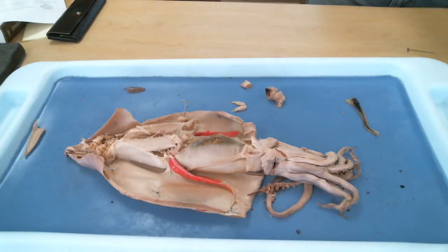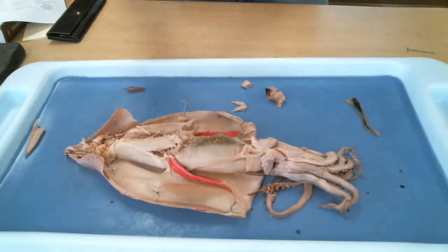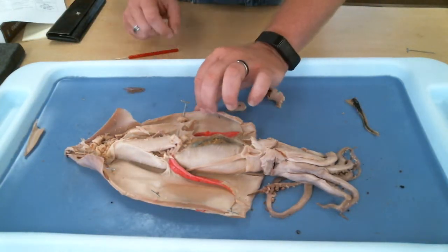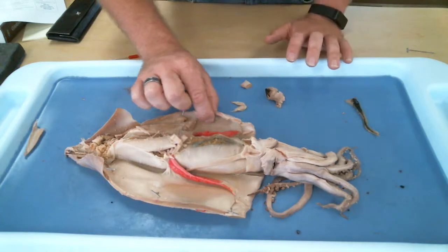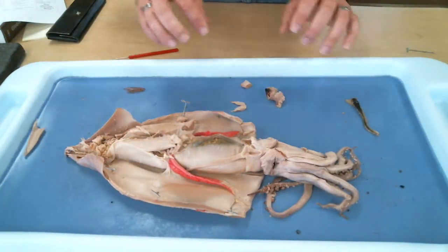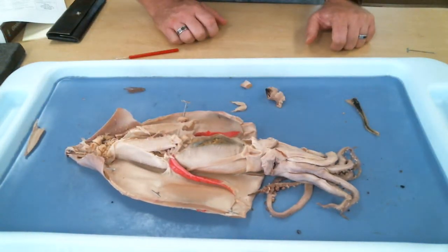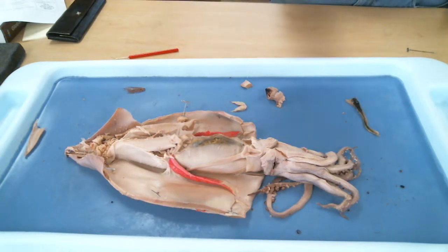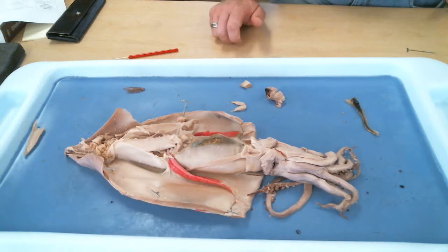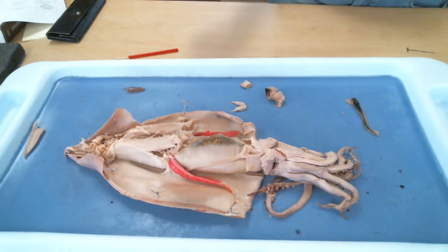We will now review the squid for those of you that are wanting a review of squid. So this guy's already been cut open. The tissue that's been wrapped around the squid that we had to cut in half to get to this view, what is the name of this tissue? That is the mantle. That is the key tissue that this organism has that puts him into the phylum that he belongs to. What's the name of the phylum of all organisms that have a mantle?